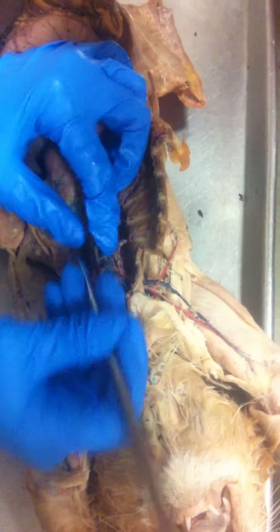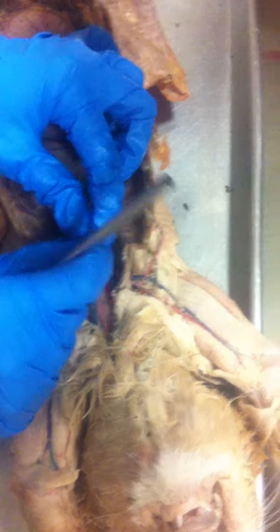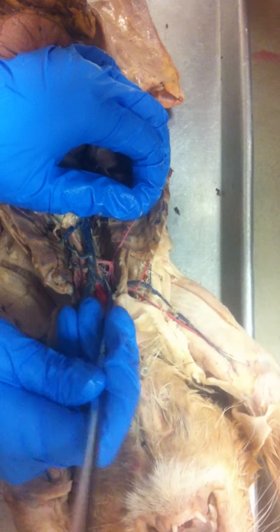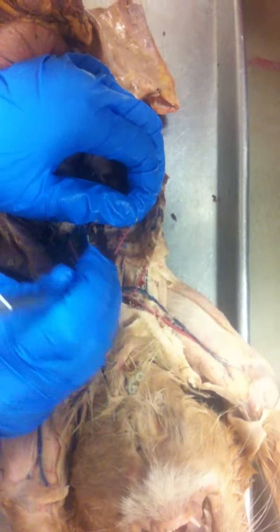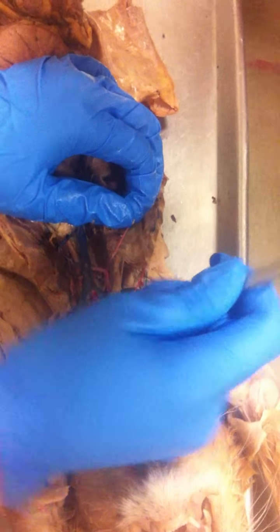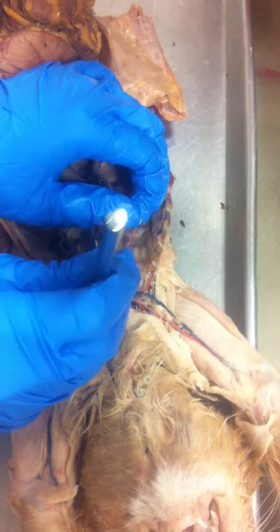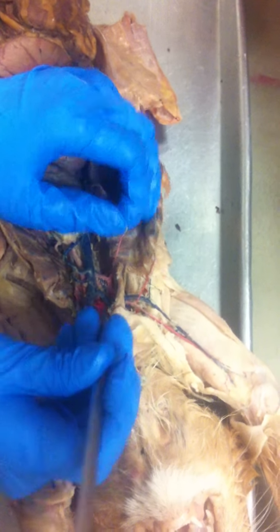Off of the right subclavian, again, you have another internal mammary. And then right there would be your vertebral. Again, remember it's going down, but then it starts to move back up. Sometimes there's some arteries that cut across that just go straight down. That wouldn't be a vertebral. It's one you don't have to know.